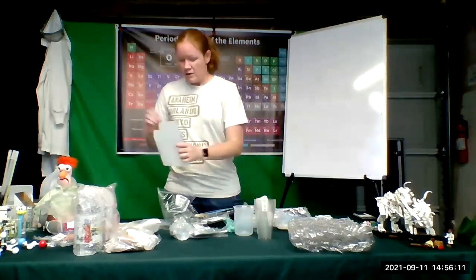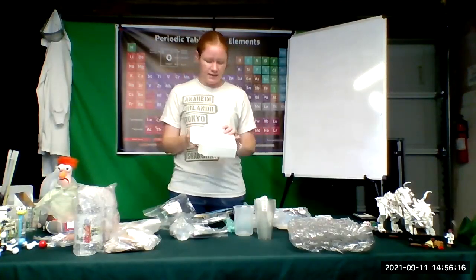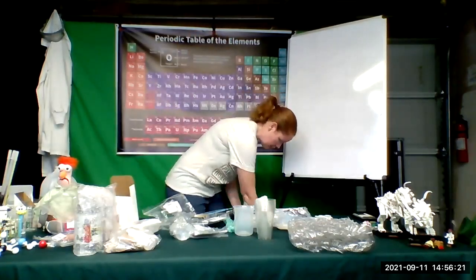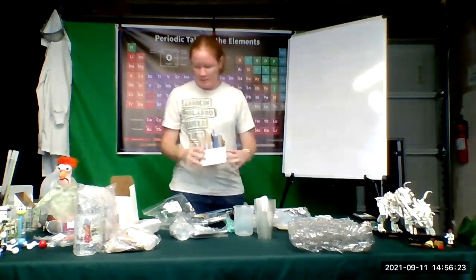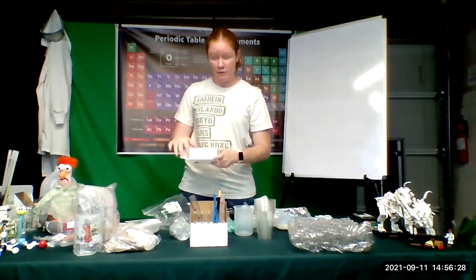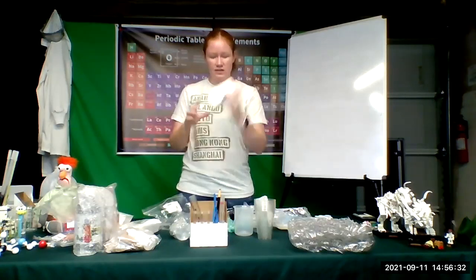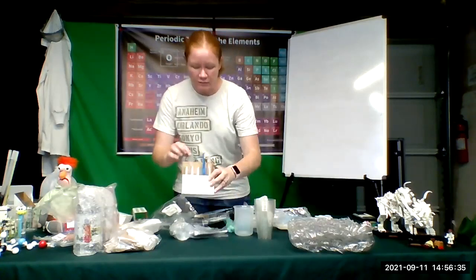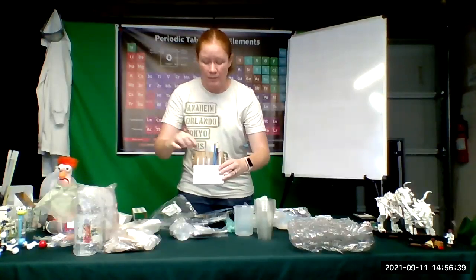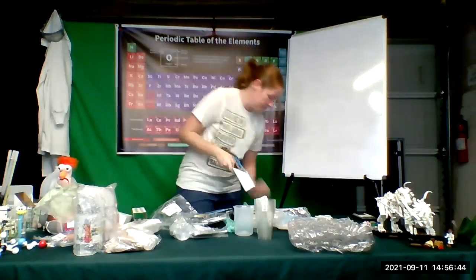So what you can do with your test tube rack, all right, is if you pop it open, actually, I'll show you what I did with my test tube rack last semester. All right, I popped it open, I took off the slanted part, there's perforations there, and then I popped open the little insert and I stuck it in there. And here's my ruler, my glass test tube, my grease pencil, my tweezers, my thermometer, and my plastic test tube. So it's all right here, ready to go.